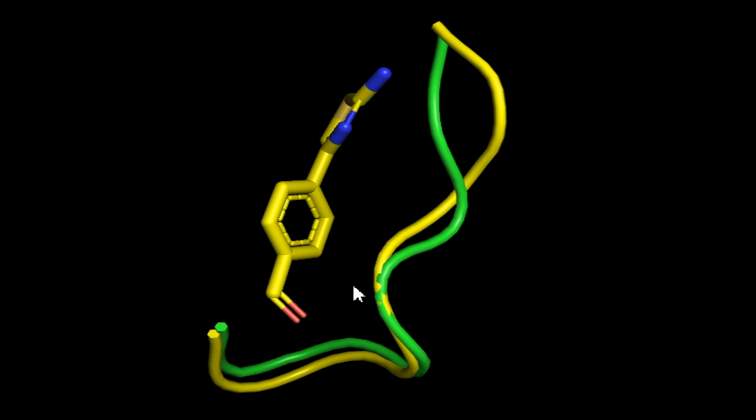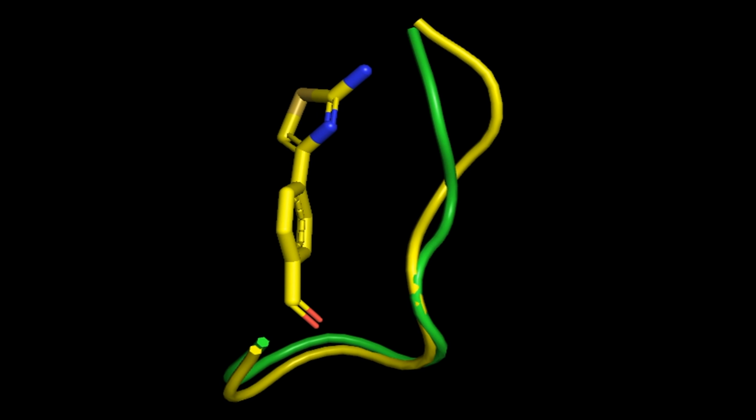The decision of which linker to use is very subjective. It depends on the price of the organic fragment, the ease of the cyclization, as well as the steric hindrance between the linker and the receptor surface. So this is solely a decision by the user.